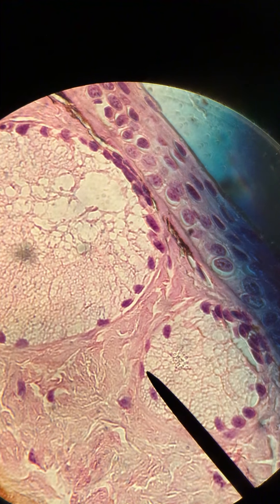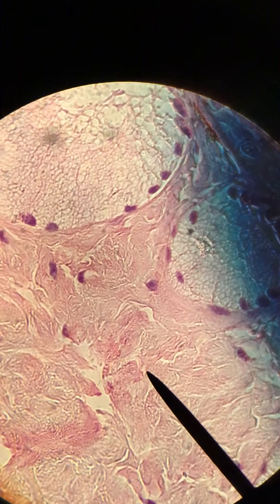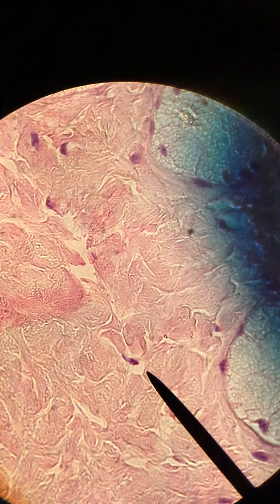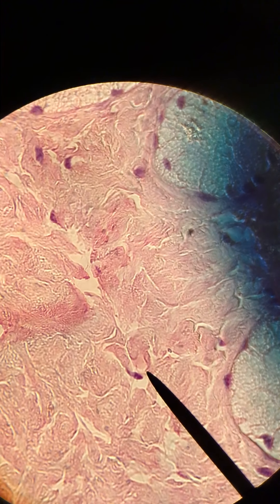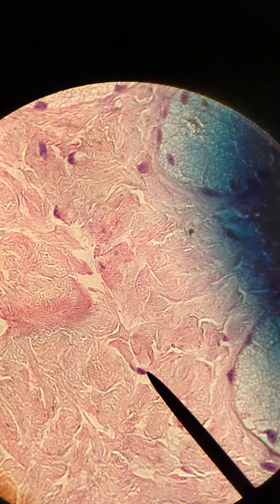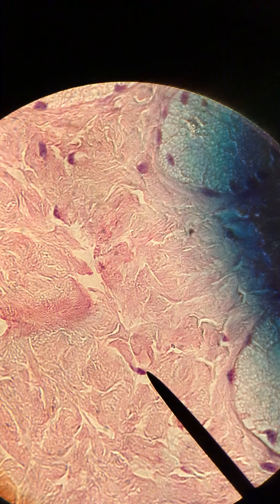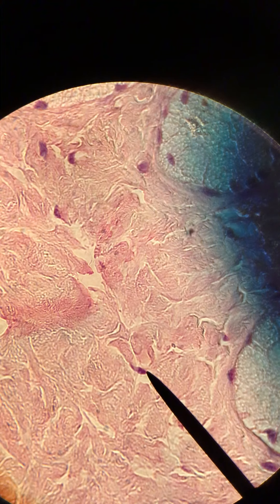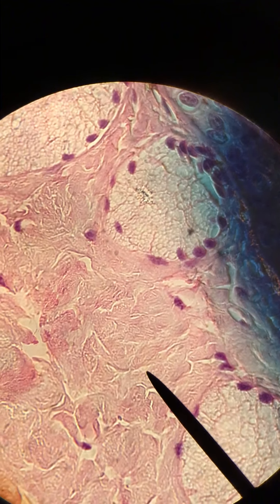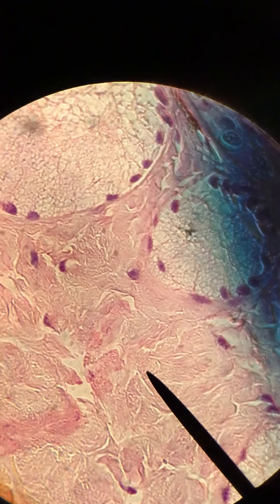The purple dots are the nuclei for our simple squamous epithelium lining those blood vessels. And irregular dense connective tissue is surrounding all those blood vessels — so all this right here is irregular dense connective tissue. If you see a darkly pigmented nucleus in there, that's going to belong to our fibroblasts — these are the cells we find in our irregular dense connective tissue. All the pink fibers here are collagenous fibers that are randomly oriented in our irregular dense connective tissue.